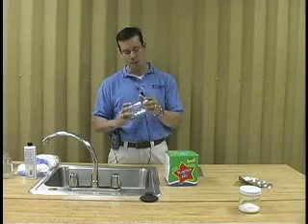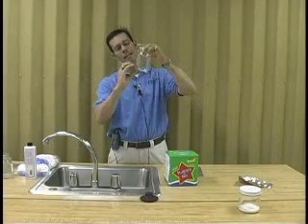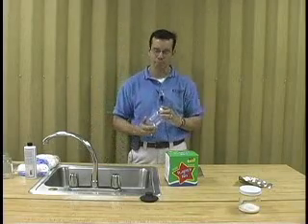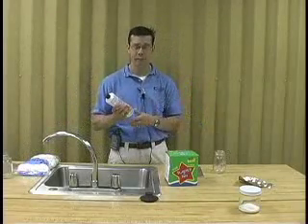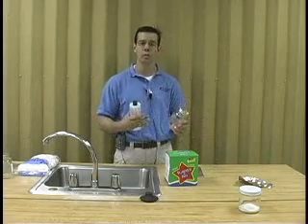So you mix your plaster of Paris, you pour it into the kill jar, and you allow it to sit for about 24 hours. Basically, you'll put about an inch of plaster of Paris in the container. Let it sit for 24 hours and it will harden. Now for the kill agent, what you use is acetone or fingernail polish remover. And what you do is you're charging the kill jar.